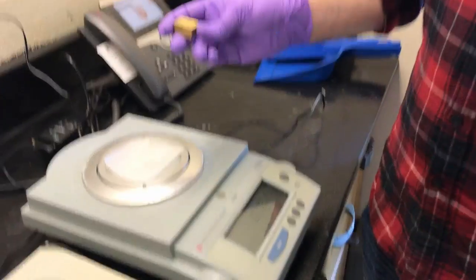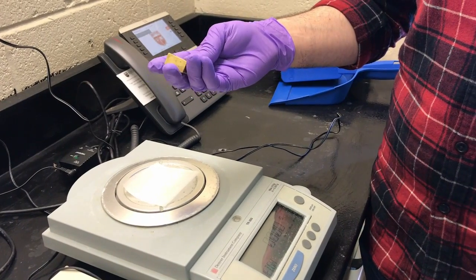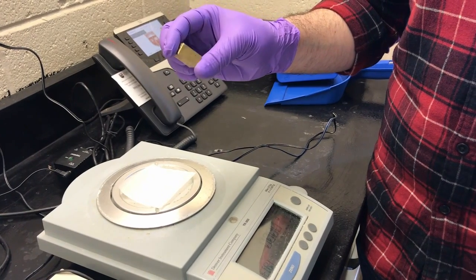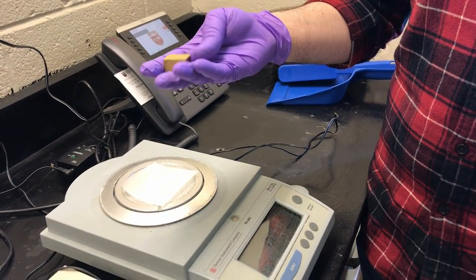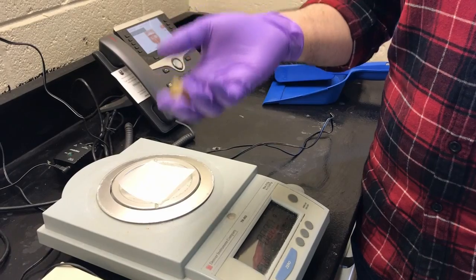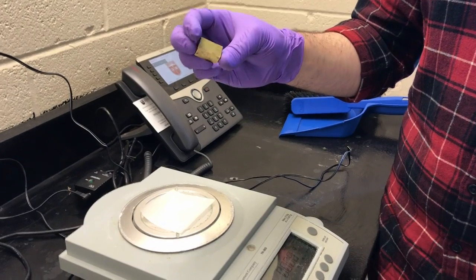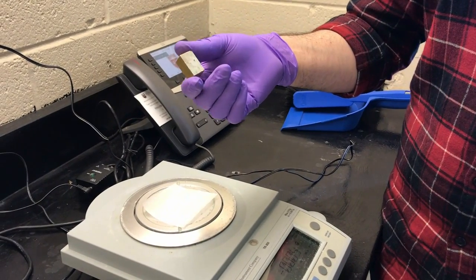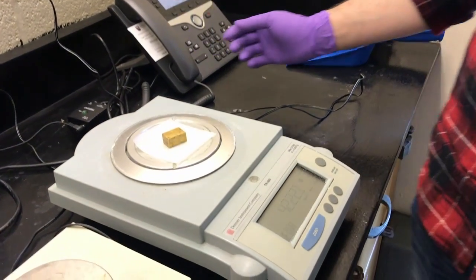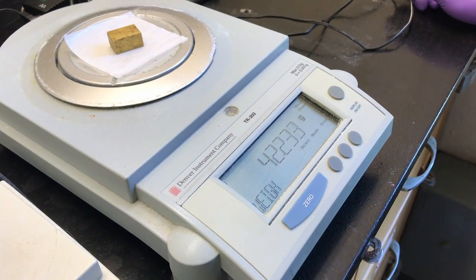Okay. So what you'll want to do is, with your chosen metal, first record which metal you have. Some might have a code, some might not. This one doesn't, so you'll just record the observation. It's heavier than some of the other metals, so you can write that it's heavy, and you can record the color. It's a yellowy, goldish kind of color. So we'll be taking the solid and we're just going to weigh it. And this will be our mass for all 3 parts.